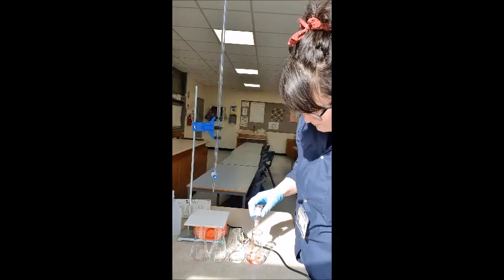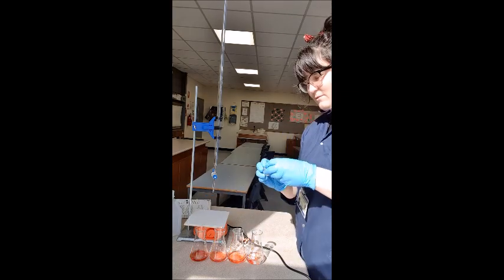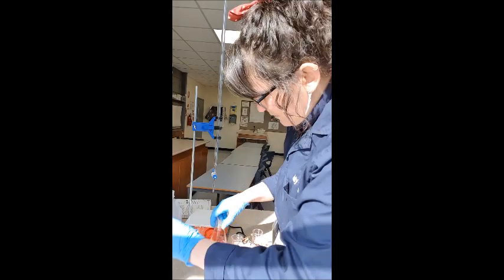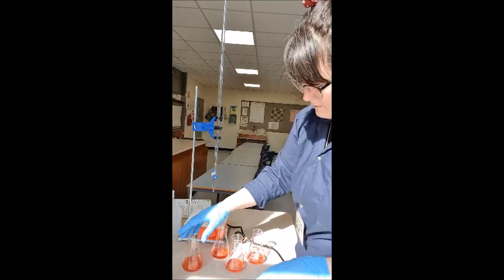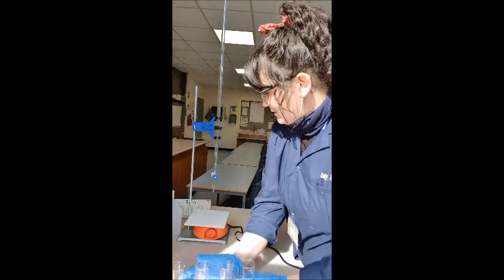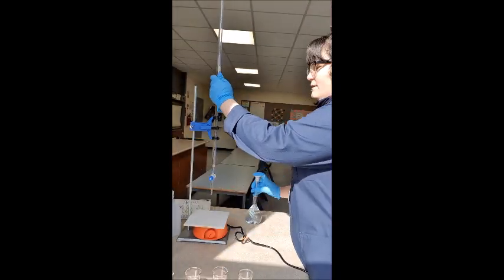So we're going to use methyl orange because it has the right range. I'm just going to put a squirt in each. So there we can see that all look like a beautiful red.